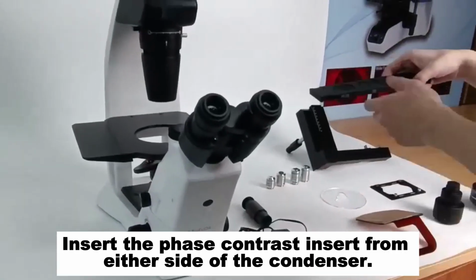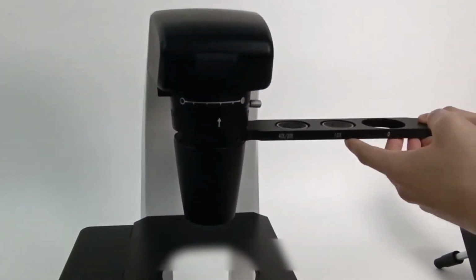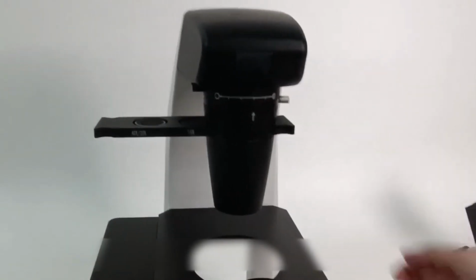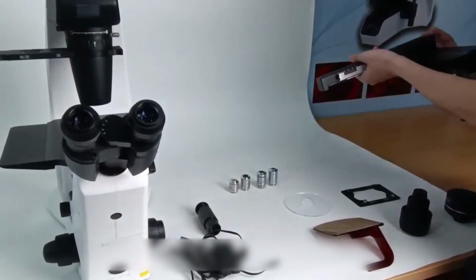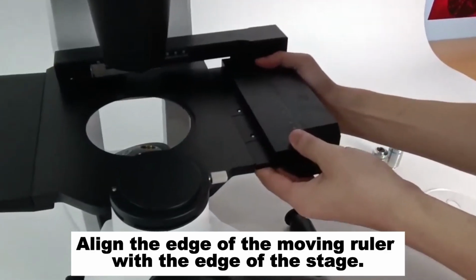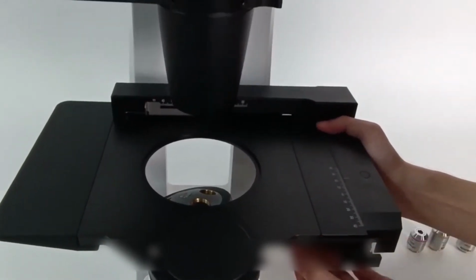Insert the phase contrast insert from either side of the condenser. Push the blank into the optical path. Move the X and Y axes. Align the edge of the moving ruler with the edge of the stage. Tighten the 3 screws below.